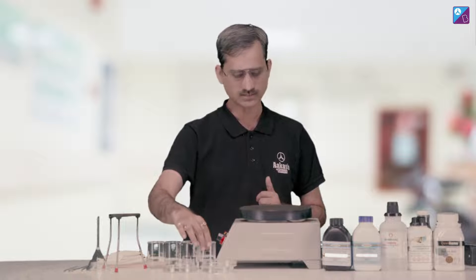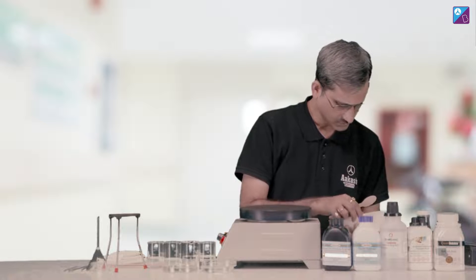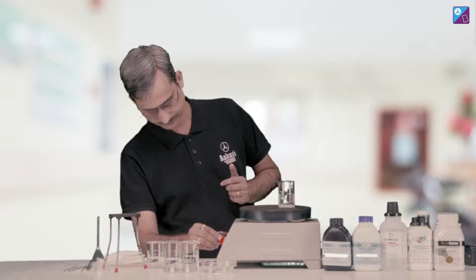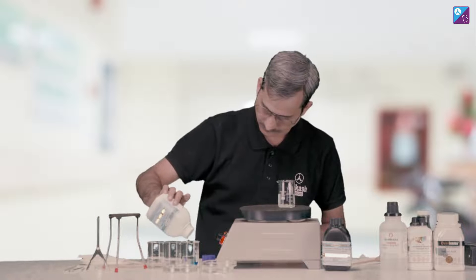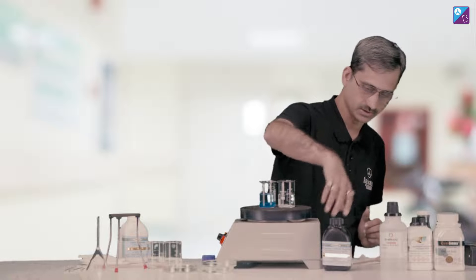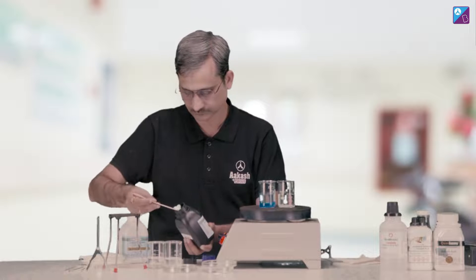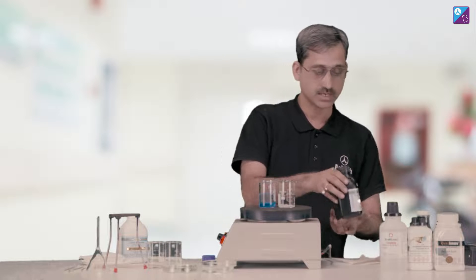We are adding potash alum — a measured amount of potash alum here — and we put it on the hot plate. Here we have copper sulfate, the cupric sulfate solution. And we dissolve a bit of ferrous ammonium sulfate. We are going to keep on adding the substance until it keeps on dissolving.